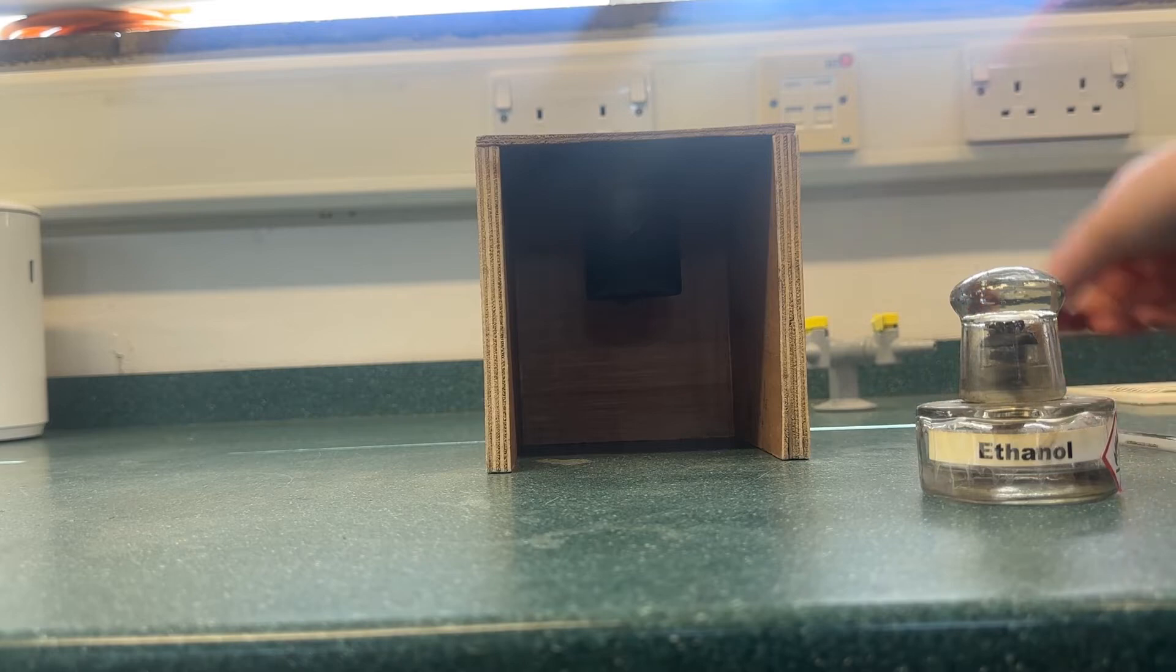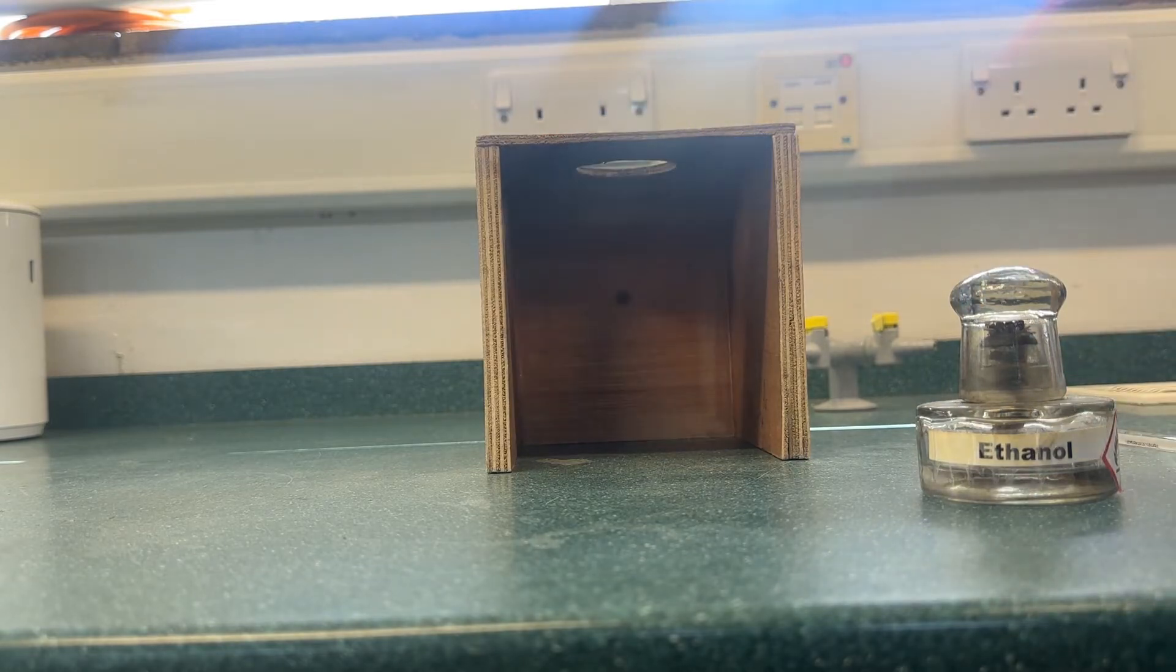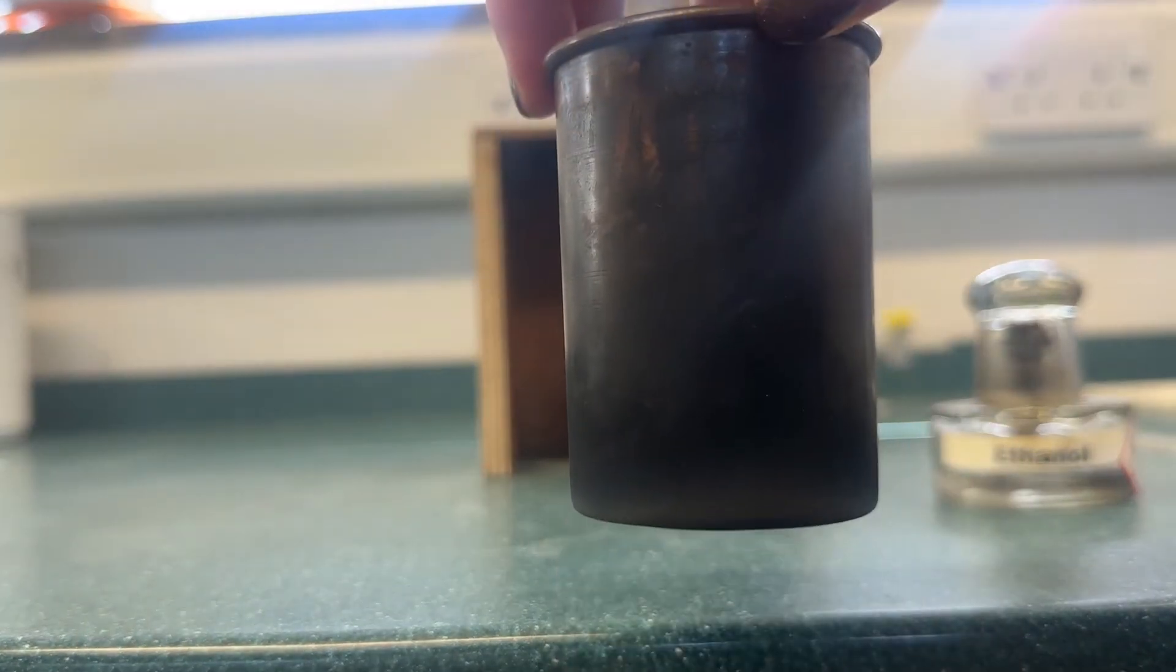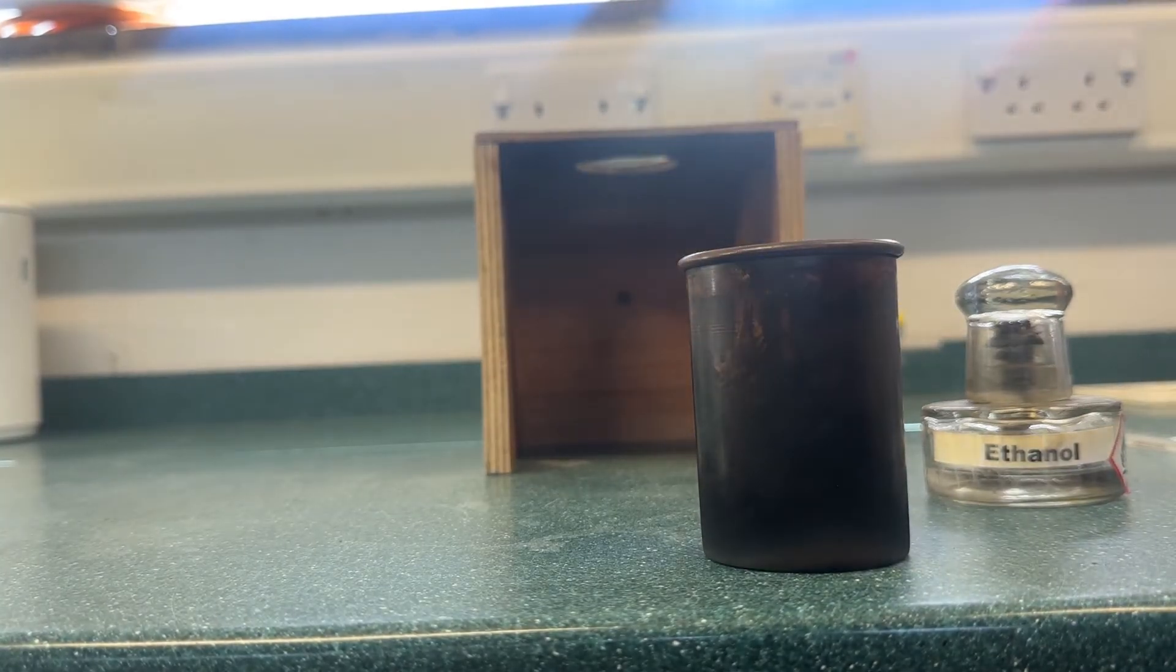We will then pour the water into a metal beaker. It's important that you use a metal beaker and not a glass beaker, as the metal will conduct heat better.